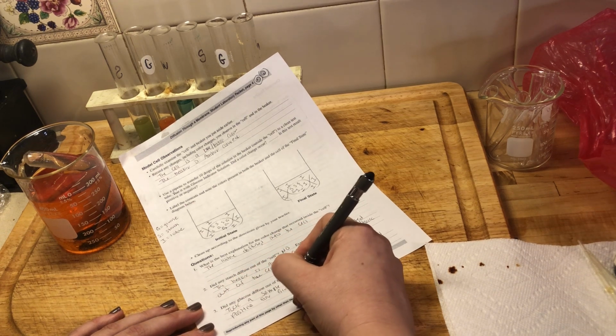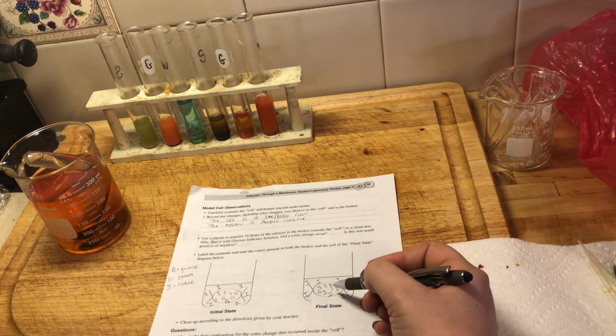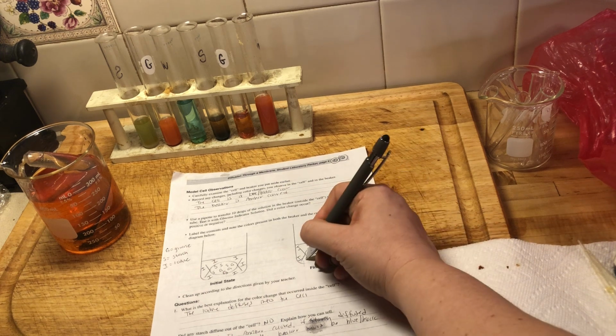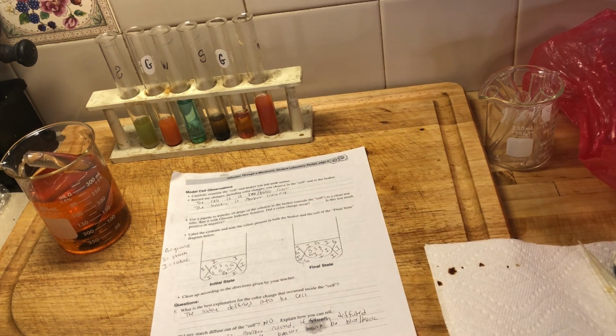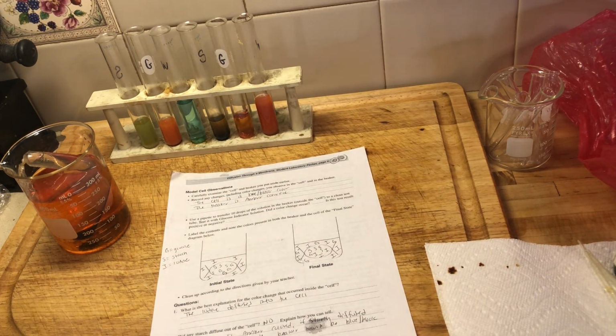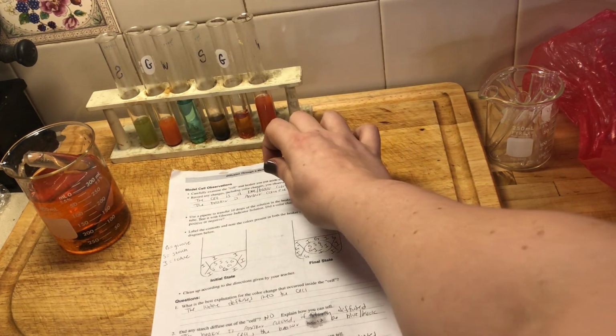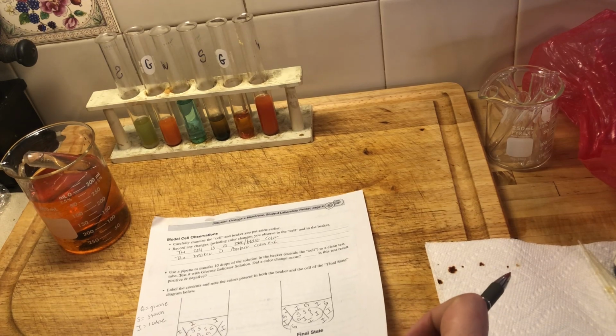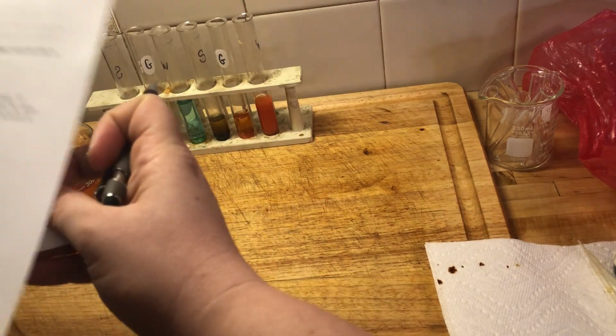So if we go back up here to our final state diagram, we can also add some G's outside of the cell where those I's are, right? Because we have determined that glucose diffused out of the cell, by testing that with the Benedict solution. Okay, we have a positive Benedict solution test, orange color for glucose, all right? So then we just have 4 more questions to work on regarding this part.